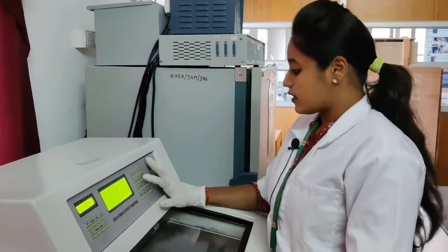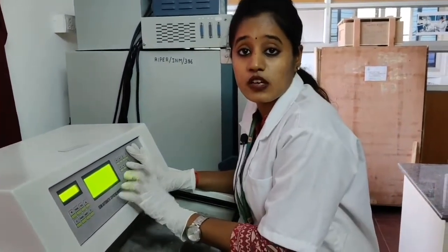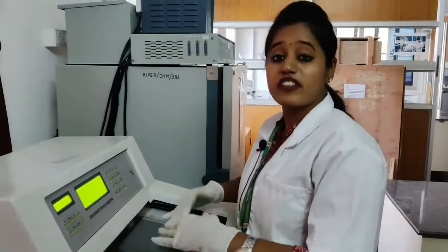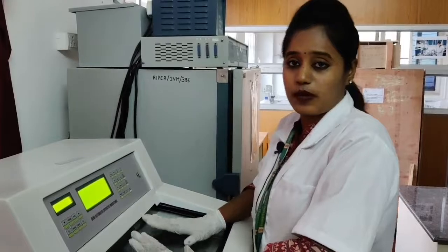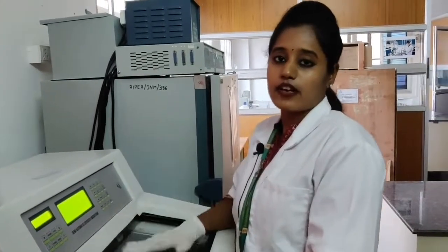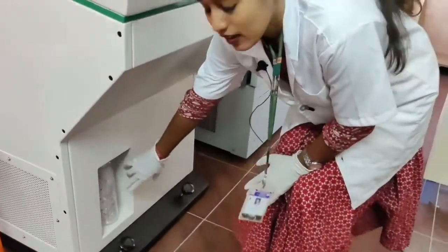I already set the time for the defrosting in the morning itself, like 16, right? That means at 16 the machine will automatically defrost. That means the compressor hot gas will pass through the entire freezing system, and it will bring everything to normal temperature like room temperature, and after that the gas and the liquid, everything will be collected in the disposable bottle which is at the bottom.